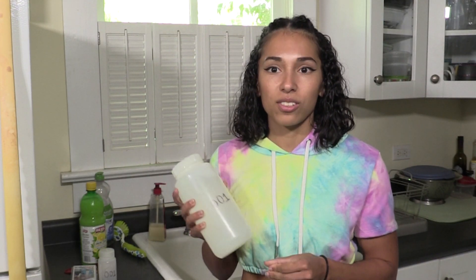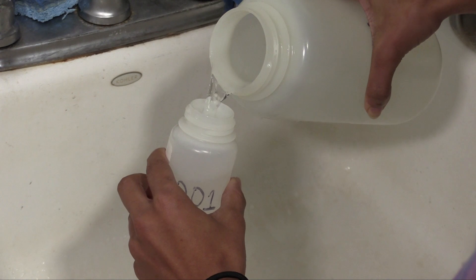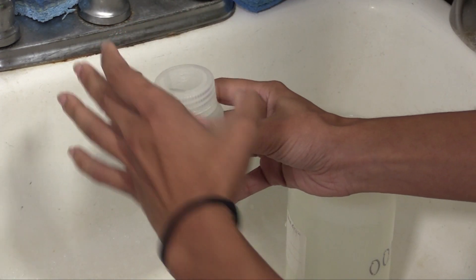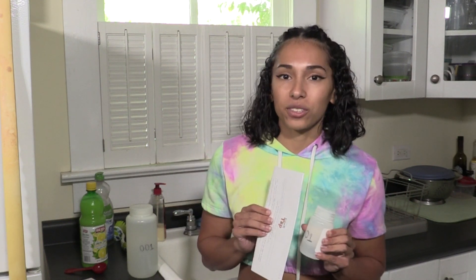After you've waited 24 hours for the lemon juice to dissolve any particulate lead that may have been present in your water, shake your bottle up again for ten seconds. Then, completely fill the small bottle with water poured from the large bottle. This small bottle, along with your kit ID slip, is what you'll be returning to us.